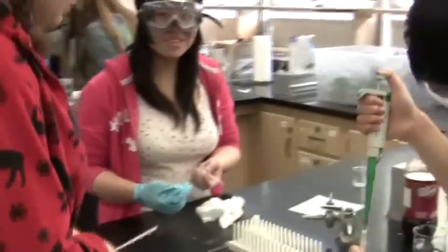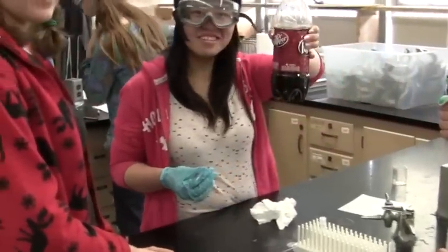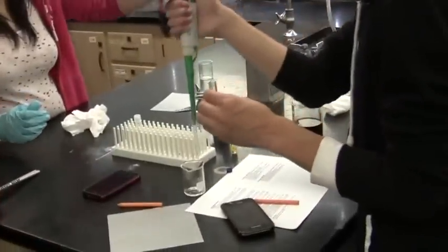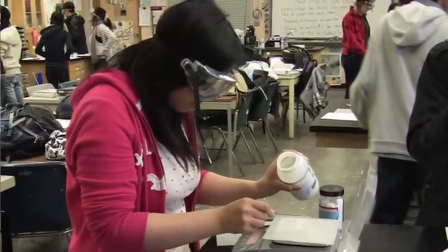My name is Terry Ha and I'm in 12th grade. I learned that the caffeine looks a little bit like oil — when I looked at it, it had little oil cells. I really thought this lab was more interesting than the others because we actually saw the caffeine extracted from the soda, and normally we don't get to see that in real life. I really want to see what's in my drink before I drink it now.